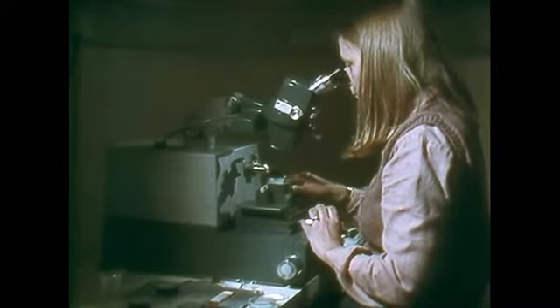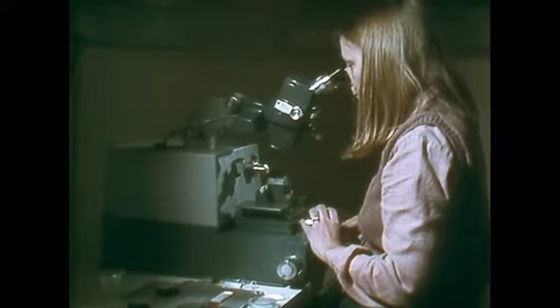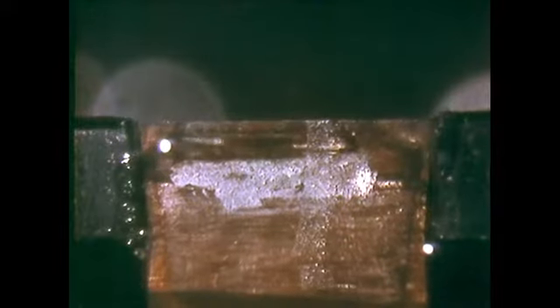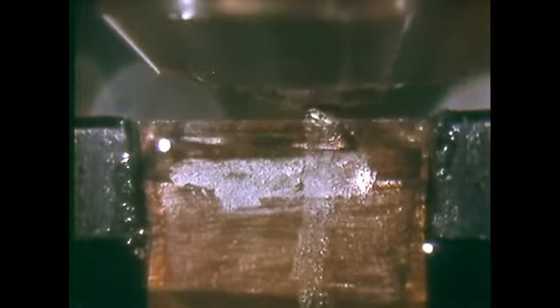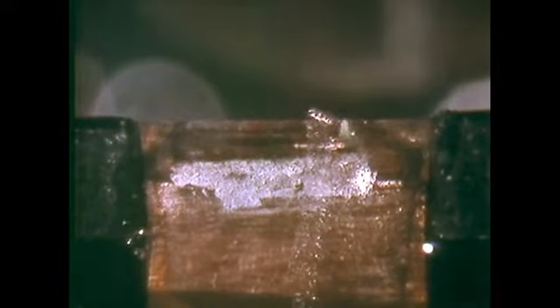By careful alignment of a sharp glass knife edge with the specimen, ultra-thin sections can be cut. The specimen holder moves down on the knife edge, producing a ribbon of sections some 50 nanometers in thickness.